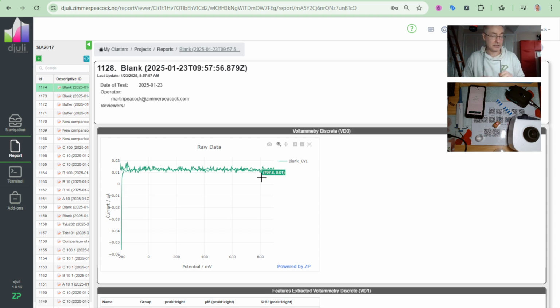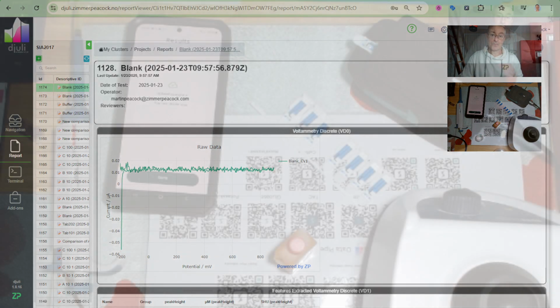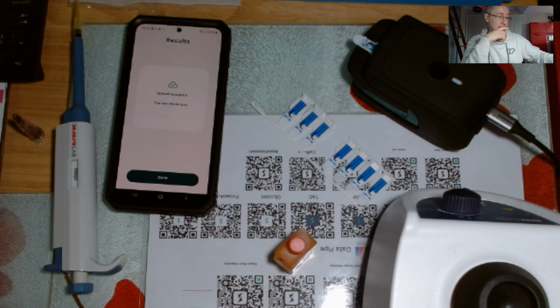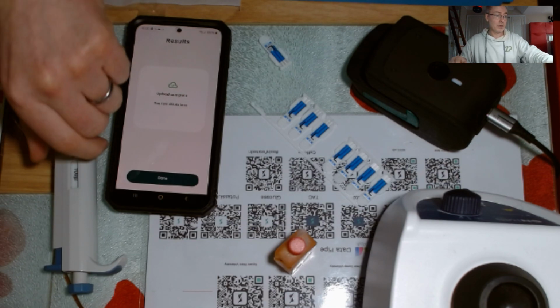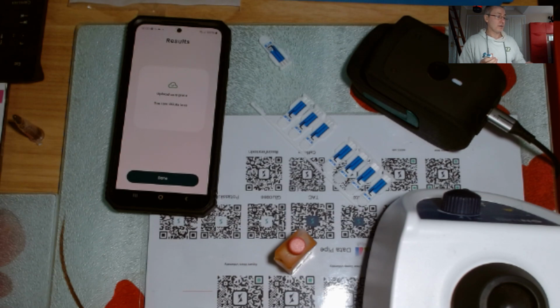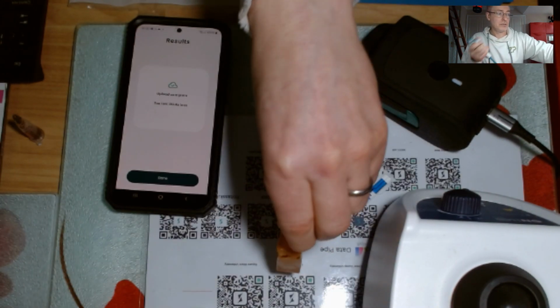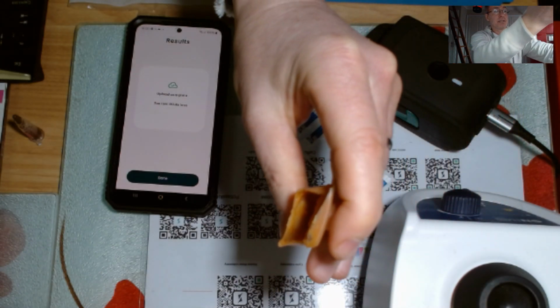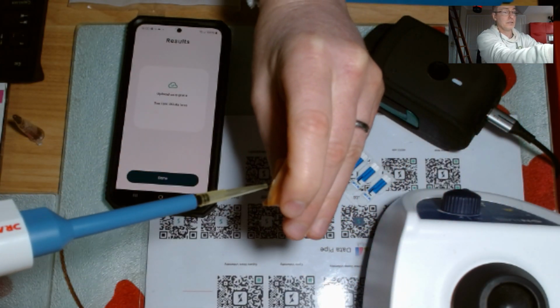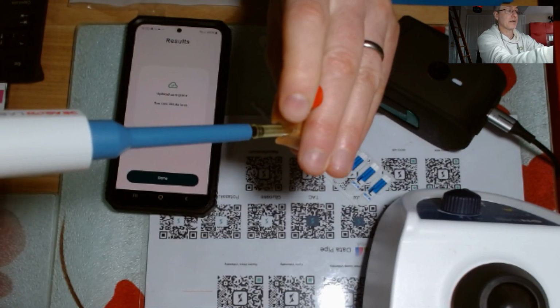Now I'm going to dig in a bit further to what their problem could be. So what I will now do is take out that sensor. I'm sorry, I'm preparing samples in real time. I realize, oh yeah, I've got some pipettes here, good. I want to grab 100 microliters of a chili sauce here. Here it is, quite viscous. When I last watched a video from this particular client, they didn't have these styles of pipettes. So hopefully they do have pipettes that now have, for example, 100 microliters.